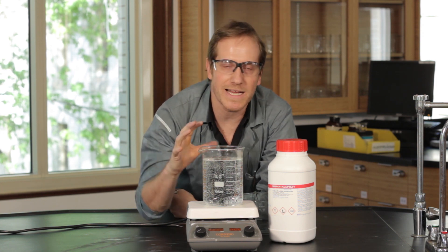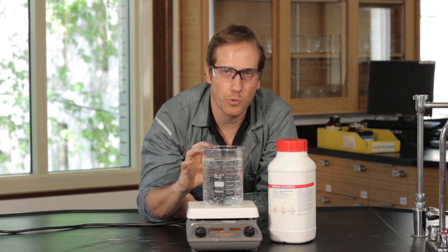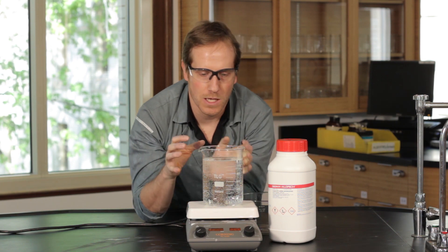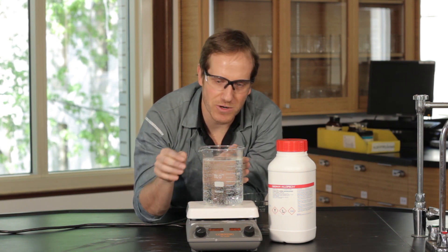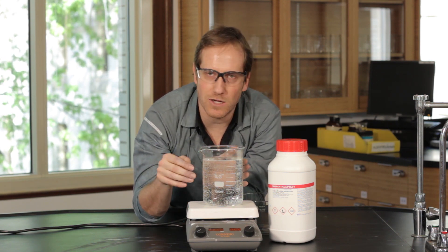The idea here is to saturate hot water with copper sulfate. When I say saturate, that means I'm trying to put more solid in and if it cannot dissolve, it's saturated.